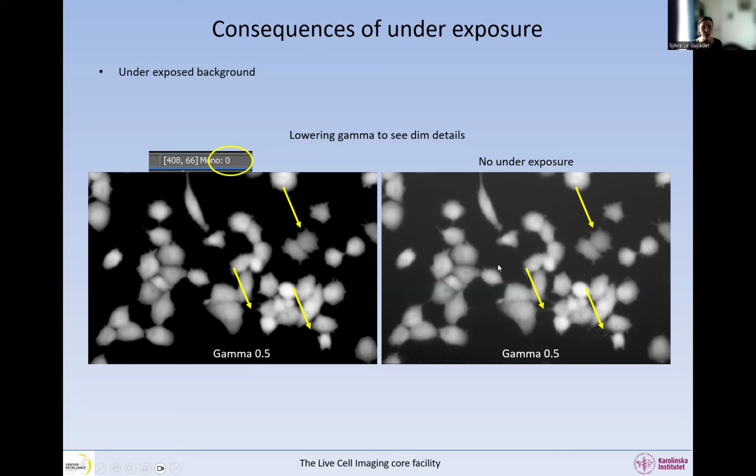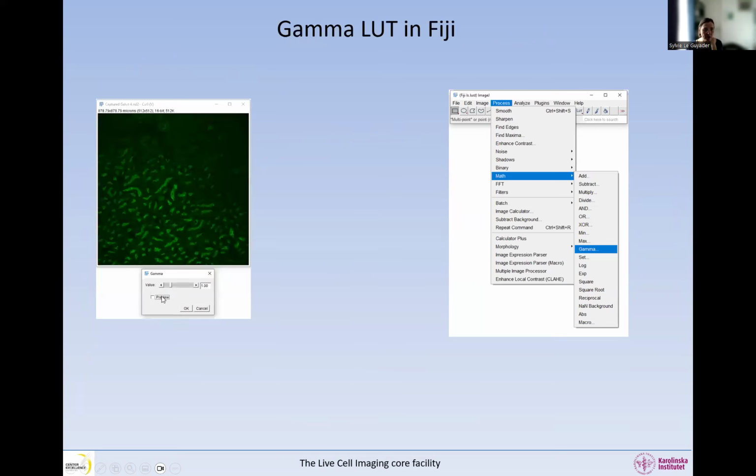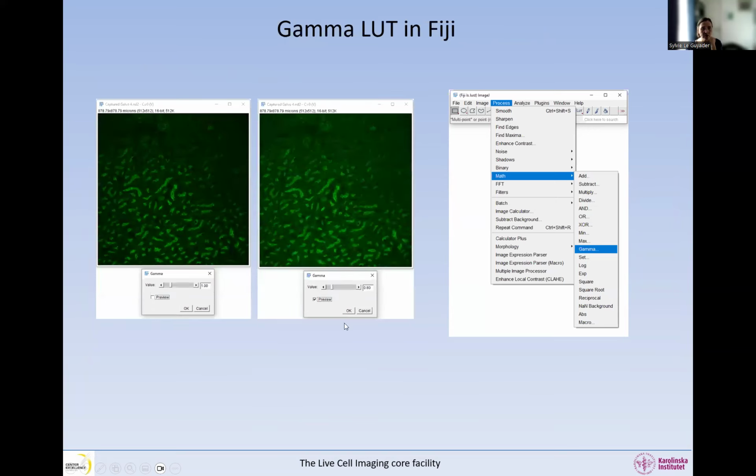So you have to explore your data a little bit. Right? In the underexposed image, there's no fine intensity details at the cell edges. So explore your data so that you know if there is a problem or not. In Fiji, the gamma is under Process, Math, Gamma. And this is what it looks like. You can change things, tick the preview so that you get to see things in the dimmer area in this sample. And in Fiji, always work on a copy of the original.